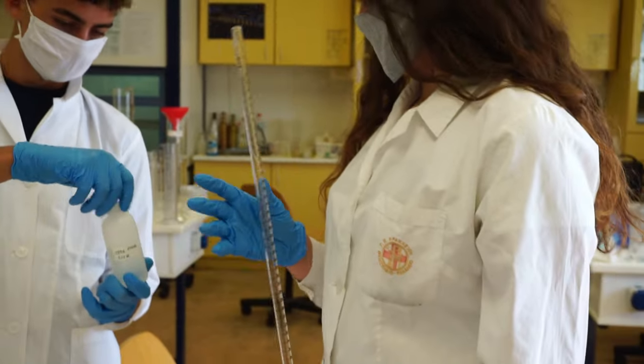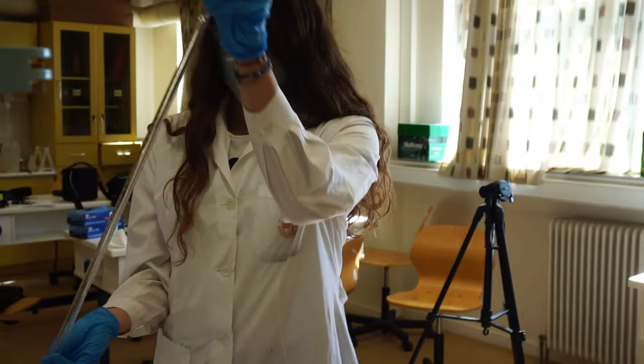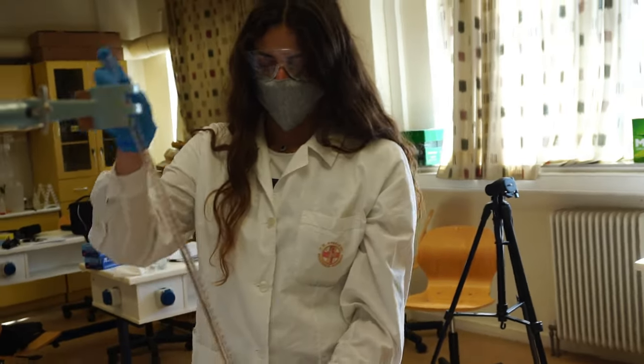After rinsing the burette with water, we wash it with the EDTA solution and then fill it to the top.